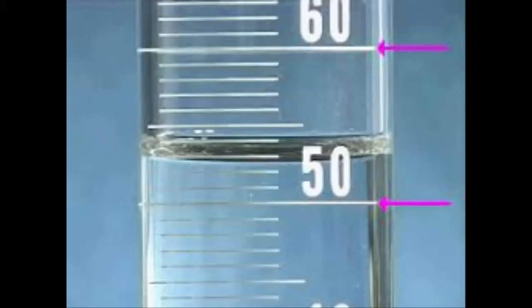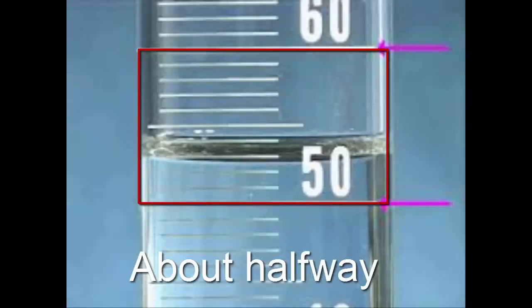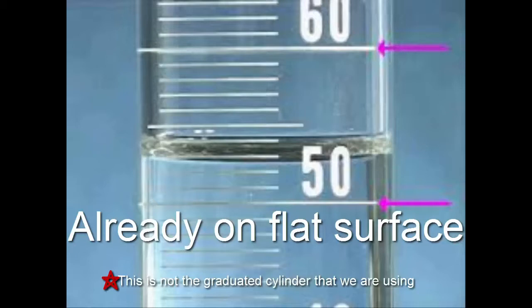First, put any amount of water that fills up the graduated cylinder to about halfway. Be sure that the graduated cylinder is on a flat surface before you take the measurement.